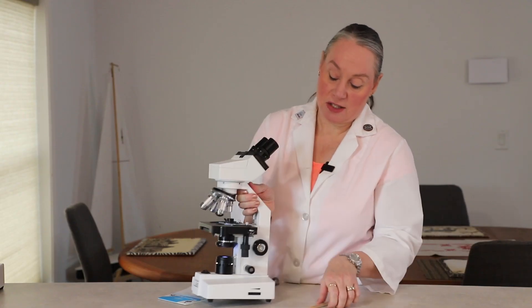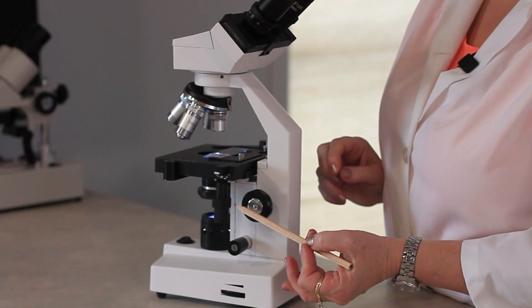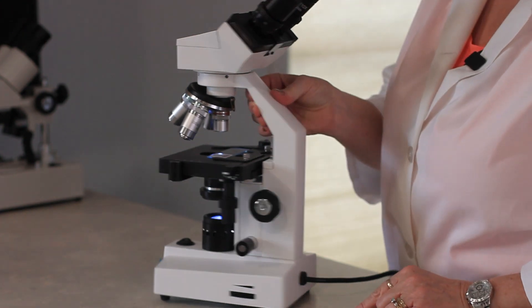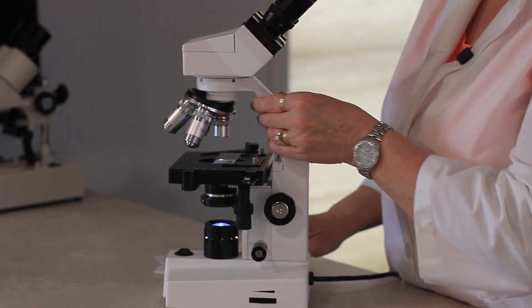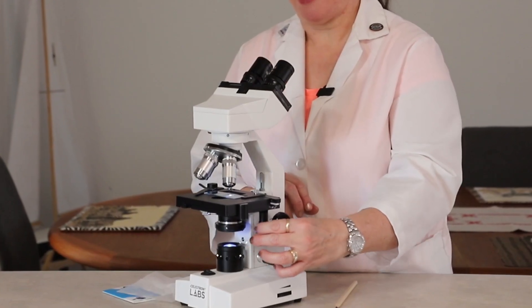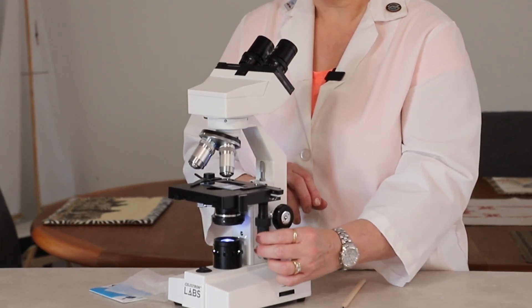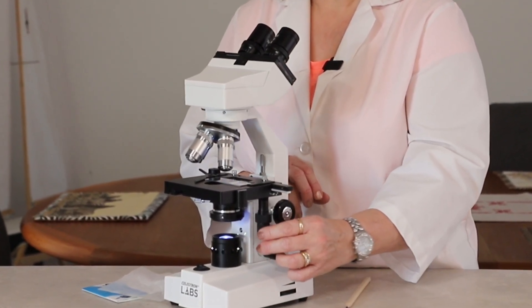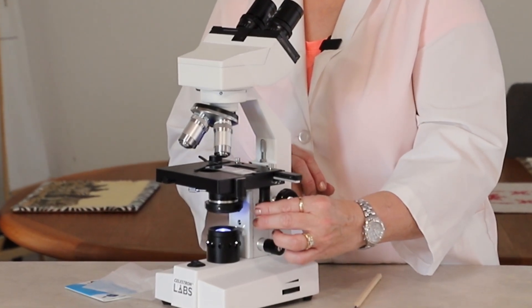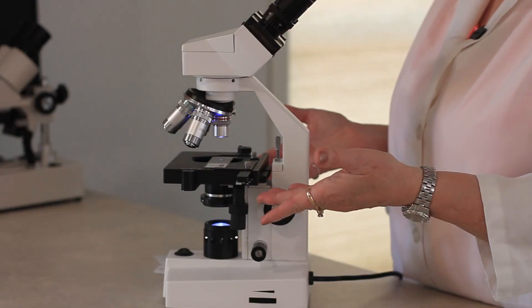Now I can use these stage adjustment knobs here to move the stage so that my specimen can be inside the view of the lens where I want to look. This one will move my specimen forward and back, and this one will move the specimen from left to right. So as I find my specimen, I'm ready to go.